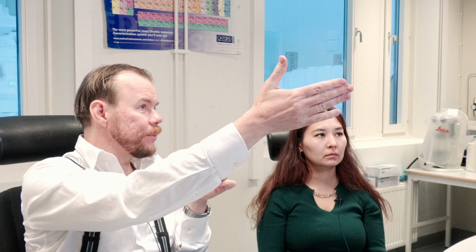A general thing about EDS measurement is that it is too easy to do EDS measurements. It's so easy to make mistakes which fool yourself. That is the problem with EDS. For example, one very silly thing is that when we're scanning here and get the scanned image up there, now I have been talking for 1 minute or so.